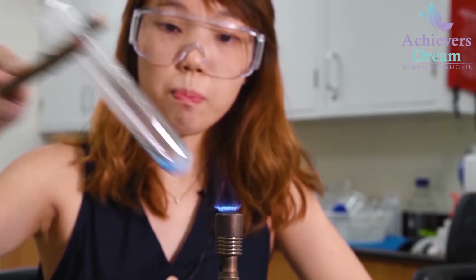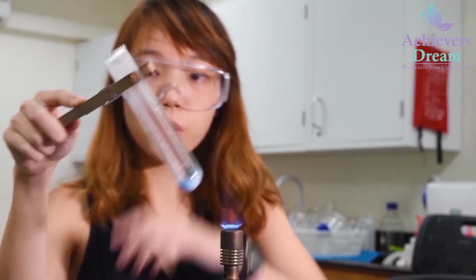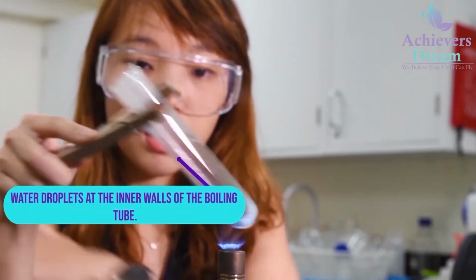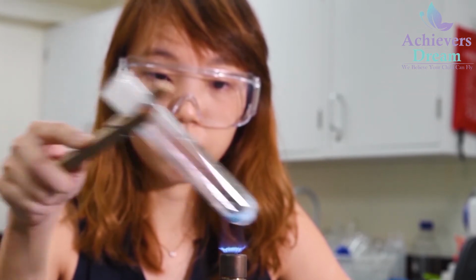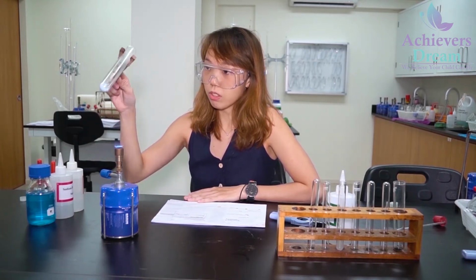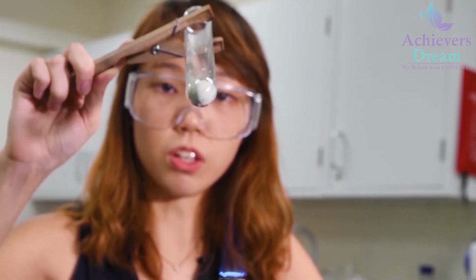You're starting to see that at the base, some of your blue solid has turned to white solid. And also on the inner walls of the boiling tube, there is water condensation. Some of it is white already. So all of your blue solid has turned into a white solid.